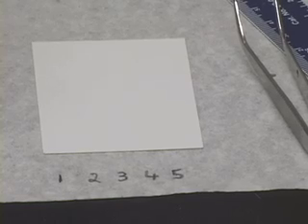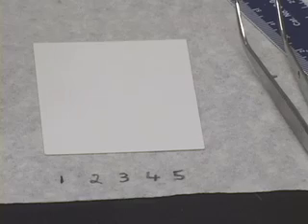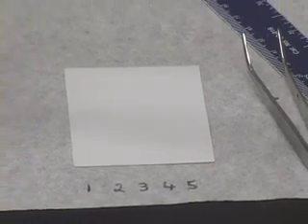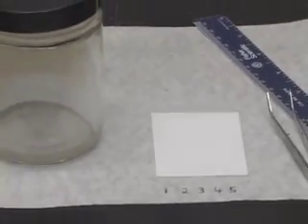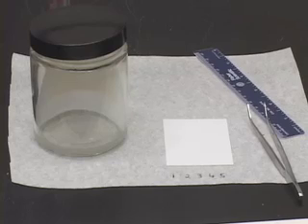So, notice the plate and mark all the spots that you were able to see after developing the plate in this developing chamber. And once you have finished doing that, you will have to do a confirmatory plate, and I will shortly explain what to do with this confirmatory plate.